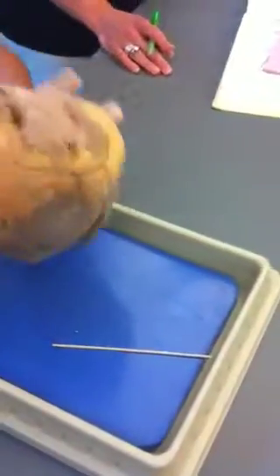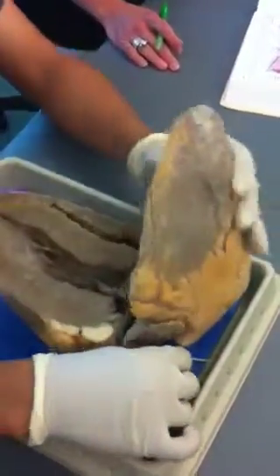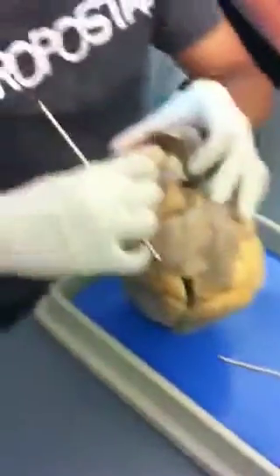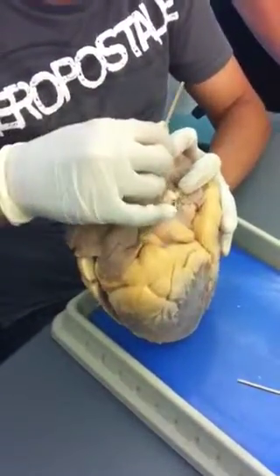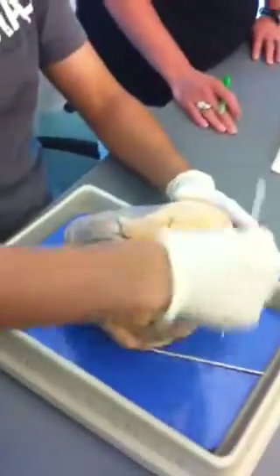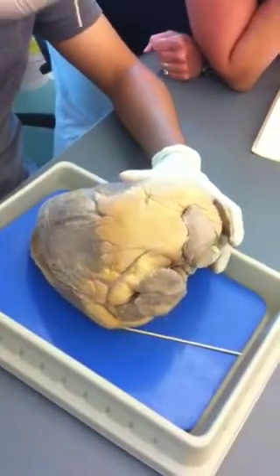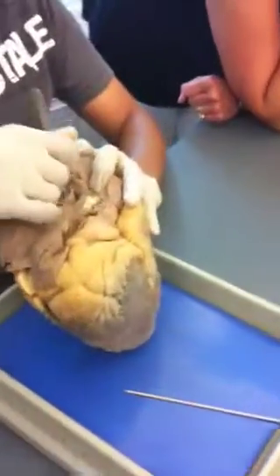Basically it opens into the right ventricle — I can't get this stick out right now, but note that it does. So the vessel in the front is the pulmonary trunk, and the vessel on the back over here is your aorta. When you look at the heart, the vessel that you see on top in the front is your pulmonary trunk — it's going to go to your lungs, carrying deoxygenated blood. And this one is the aorta, carrying oxygenated blood.